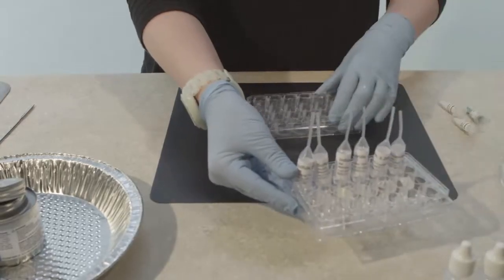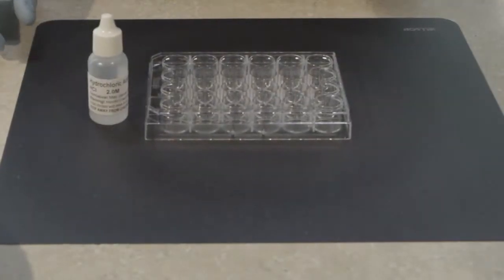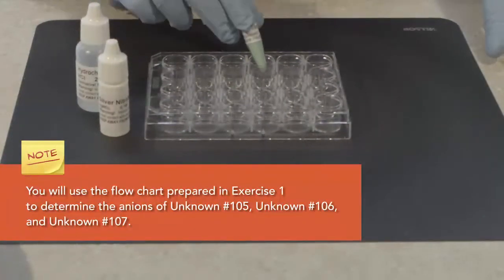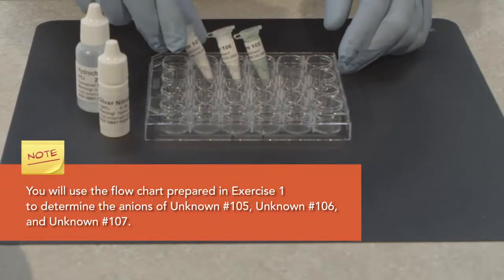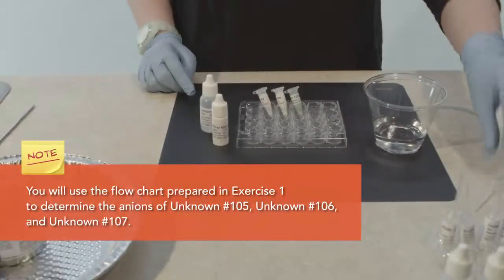Gather the well plate containing chemicals from exercise 1, distilled water, and an empty pipette. Note: in the next few steps, you will use the flowchart prepared in exercise 1 to determine the anions of unknown number 105, unknown number 106, and unknown number 107.